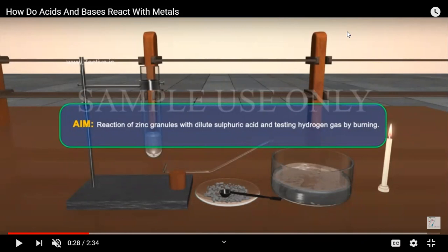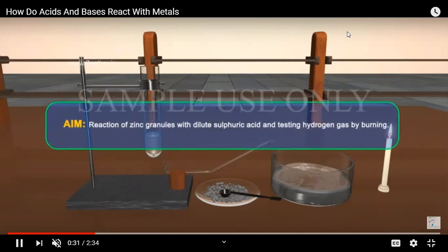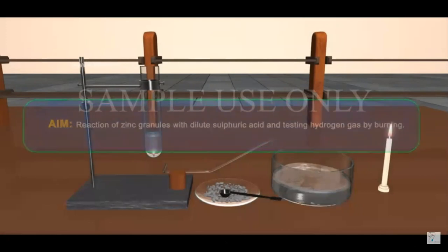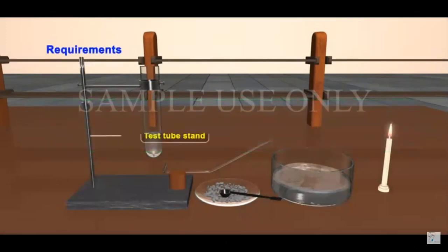First, I'll tell you what the materials required are, and then I'll let you know what chemicals are required for the experiment, and then we will proceed with the procedure. So for this activity, you need a test tube stand, a test tube, watch glass, spatula, and delivery tube.